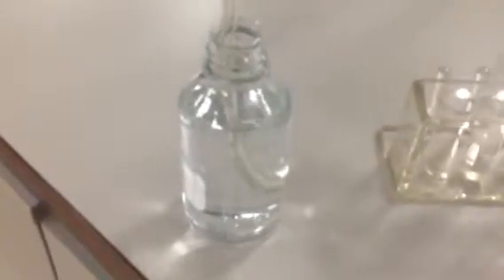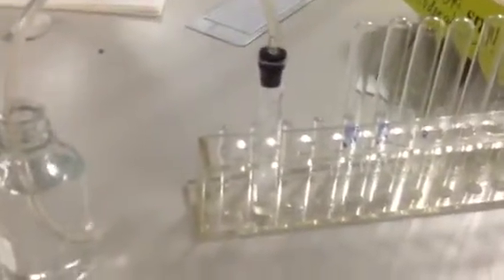So people can see it in real time as well as zoom in on that so they can see that it's bubbling. Okay. That could be it. That's the whole lab. I can see the bubbles. You can see the bubbles? Yeah. Okay. You can see it, it's fizzing there.